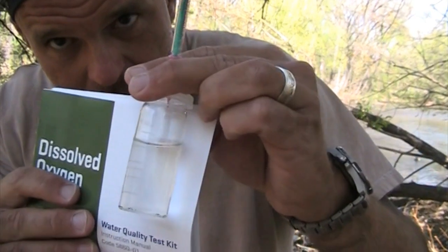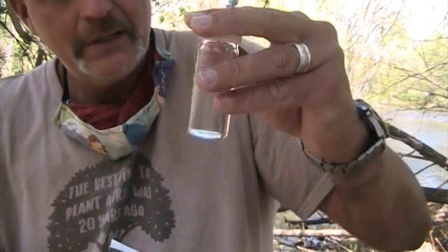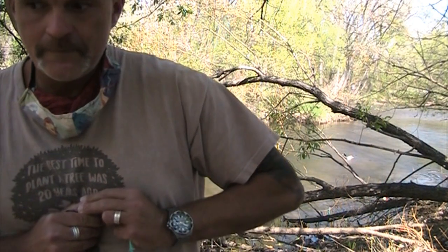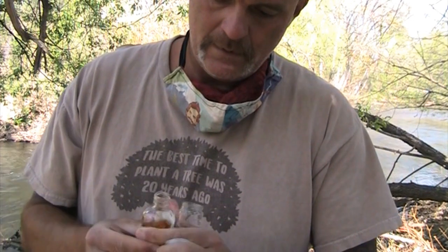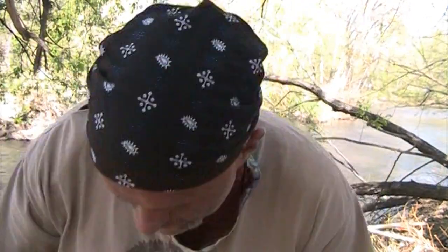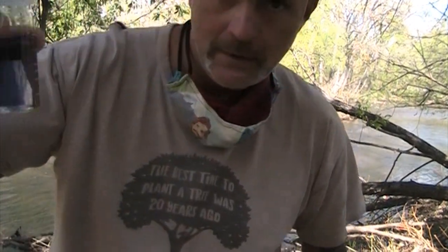And that right there is called overshooting your titration point because I added too much. Now, with your students, if that happens, my goal for the first time they do a titration is that they see what titration point looks like. If you really want them to see the titration point, all you have to do is put some more of your original mixture in the bottle. And as you can see, I brought it back to a blue color.